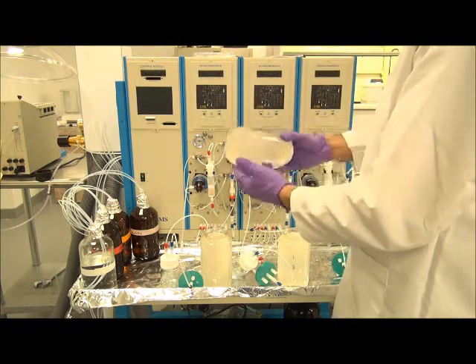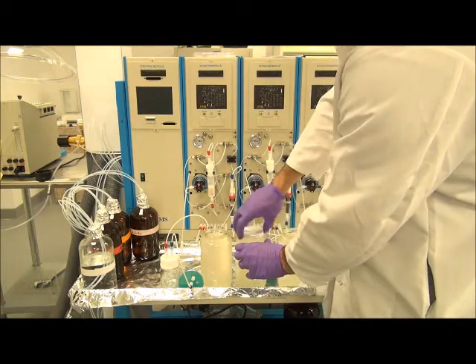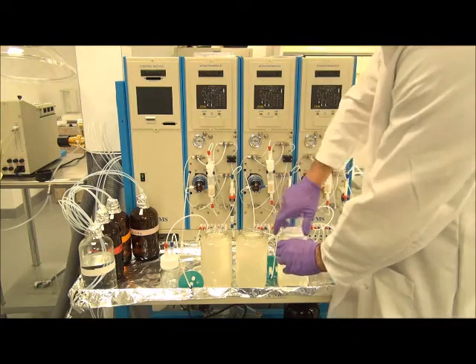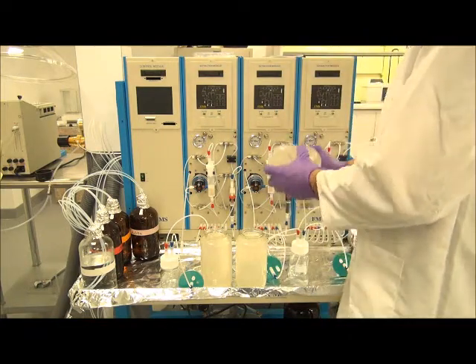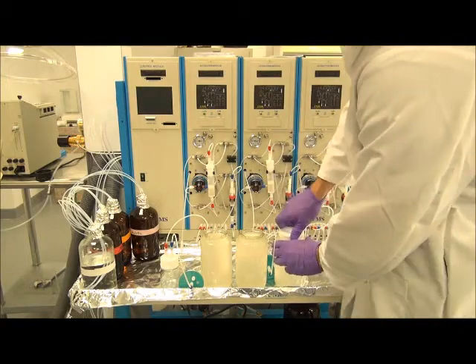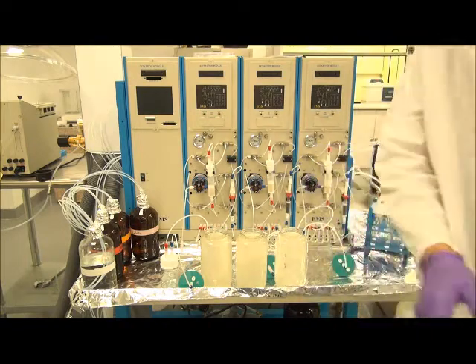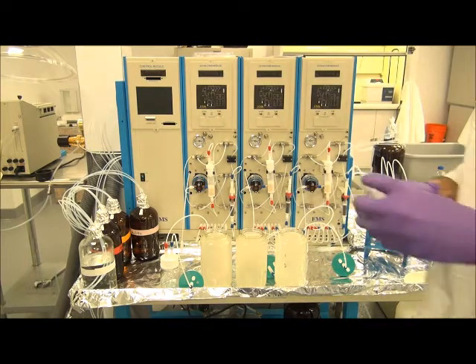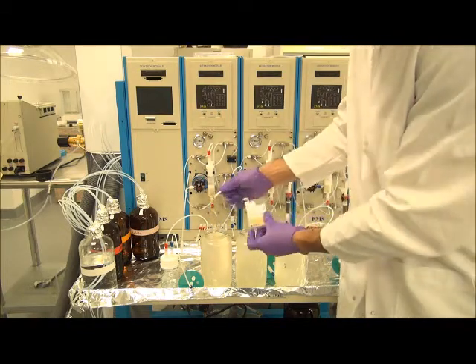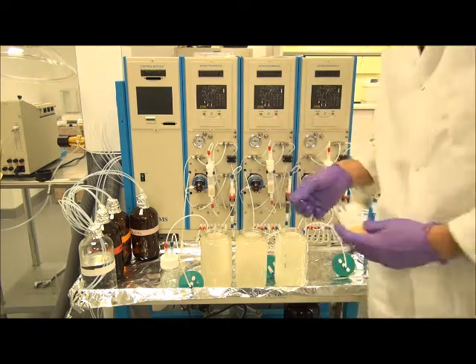You can see in the sample as I prepare this, there's a fair amount of insoluble material in the wastewater samples. There is a surfactant which creates that emulsion-like frothing, as well as other soluble materials, to synthesize all of the aspects of a live, real wastewater sample. We'll then check the pH of the samples to make sure that they are indeed 2 or less.